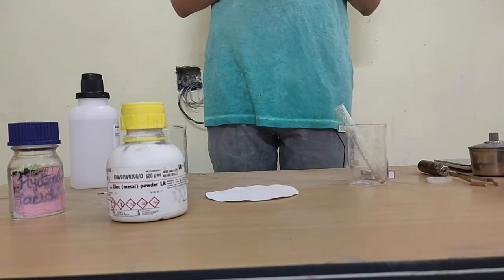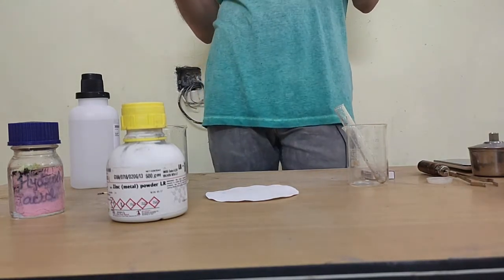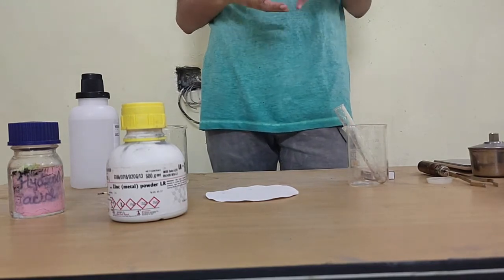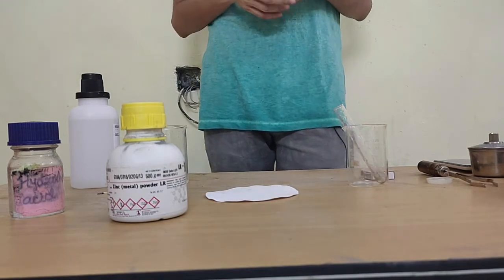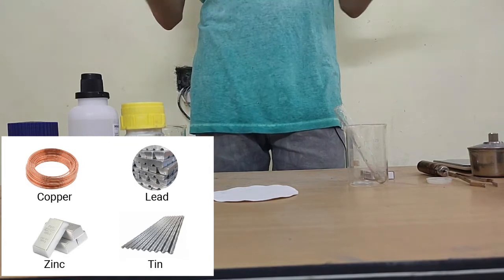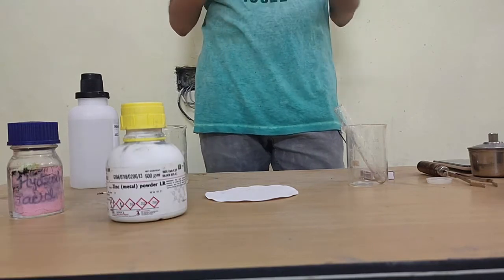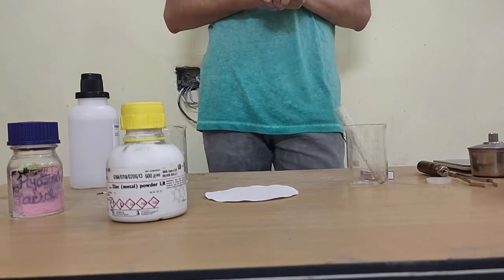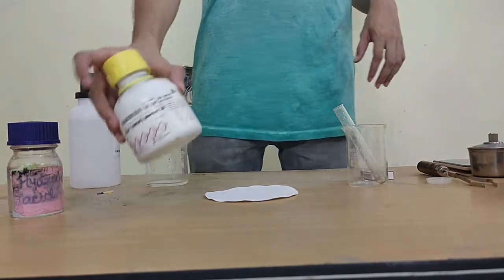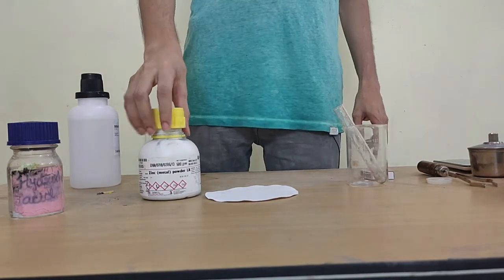For today we are going to focus on one thing, and that is how an acid and a metal are going to interact. Okay, acids you are familiar with, whatever we have looked at. Metals, just like the metals that we use in everyday life, be it iron, zinc, copper, all of these are metals, right? So we can use any of these metals for this reaction. I'll be using something called zinc metal. Over here I've got it. It's a metal that's there in powder form, and I'll be showing this to you shortly.